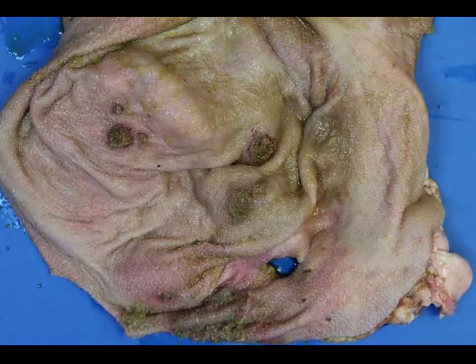Okay, this tissue from a goat. Be very careful with your morphologic diagnosis. Be very thorough and give me a predisposing condition. Okay, time's up. This is the rumen from a goat. We have multifocal areas of ulceration and necrosis within the rumen that are surrounded by an area of hemorrhage. This is a very characteristic lesion.